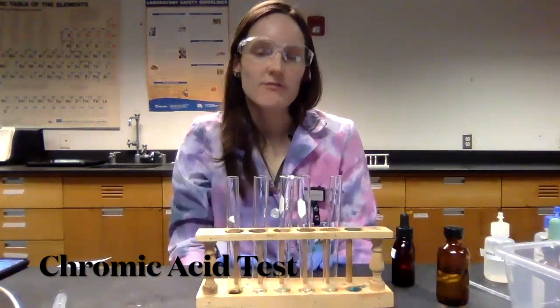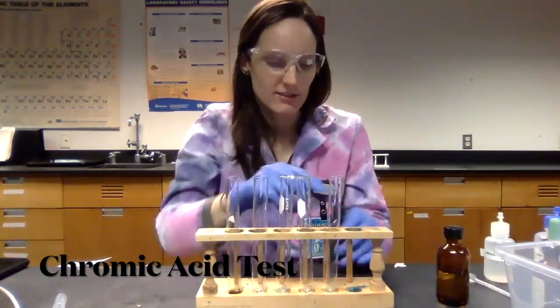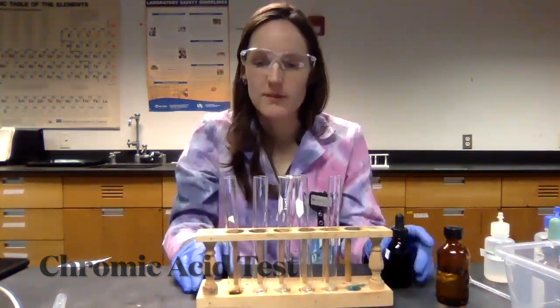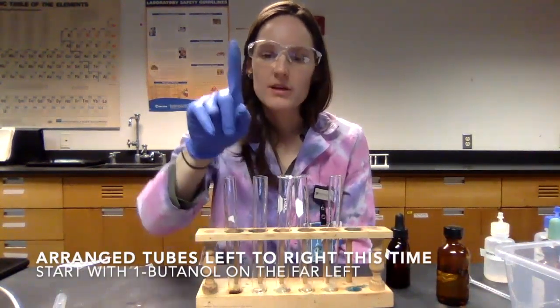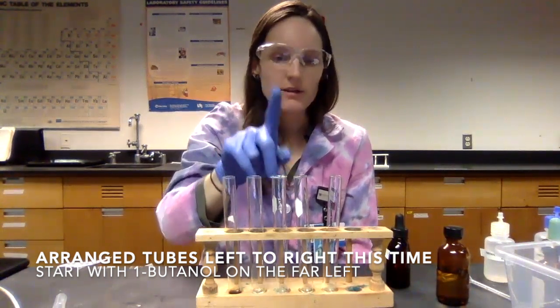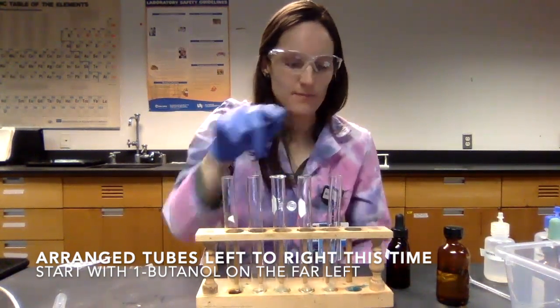All right, so I finished my solubility experiment. I'm going to conduct the chromic acid test on my test tubes. So I actually already started, but let me walk you through what I'm about to do. In clean test tubes, I have 10 drops of my 1-butanol, 2-butanol, 2-methyl-2-propanol, my phenol, and my diethyl ether.